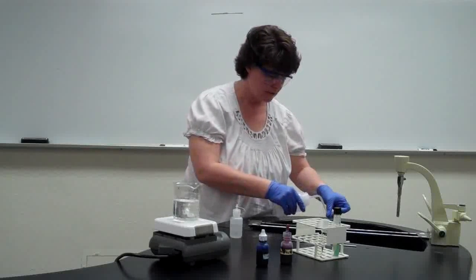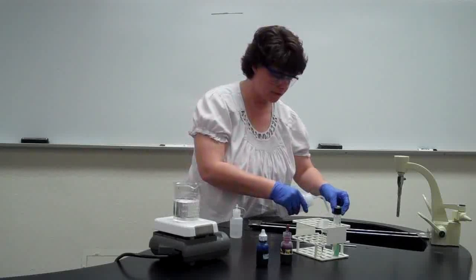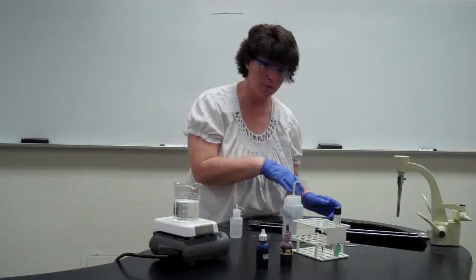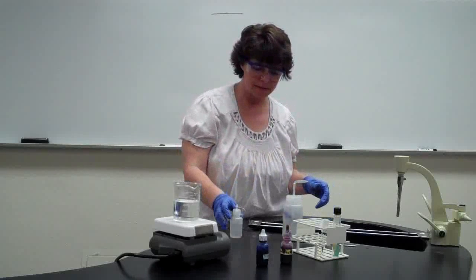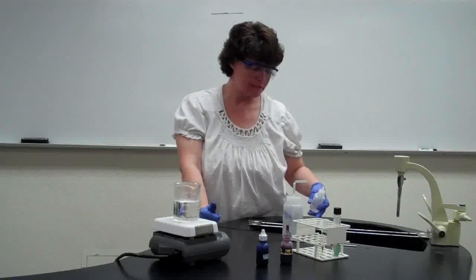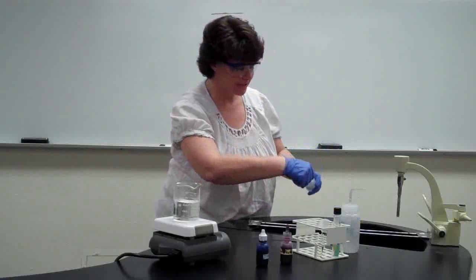Okay, just the same as with the gram stain procedure, the next step. Well, actually the next step in the gram stain was the mordant, but we're not going to do one of those here. The next step is going to be the decolorizing. If you recall from the gram stain, the decolorizer was either alcohol or acetone alcohol. In this, it's going to be acid alcohol. The reason that we use acid alcohol is because if a cell is acid-fast positive, it won't decolorize even in the presence of acid. Okay, so we're going to use acid alcohol for our decolorization.